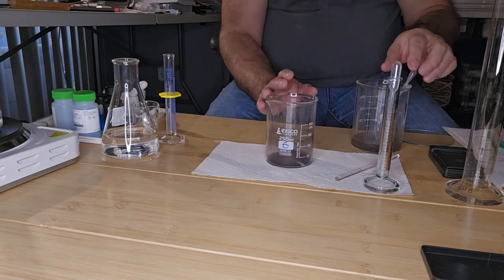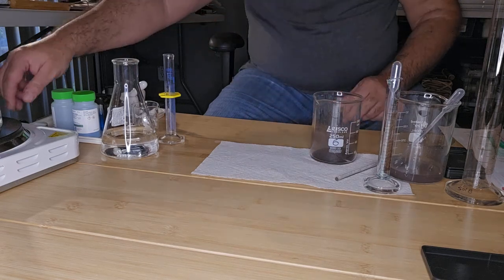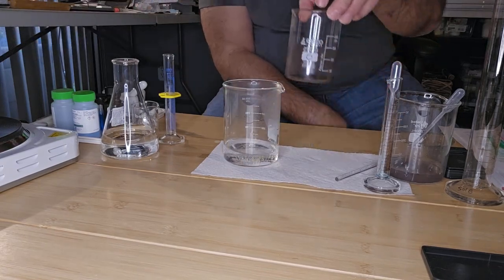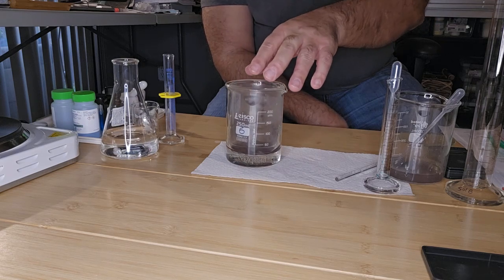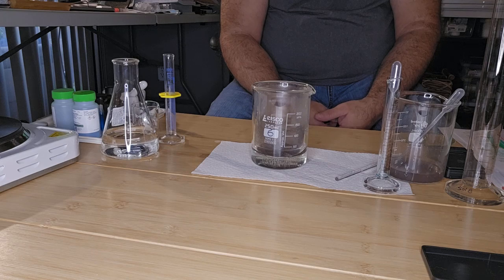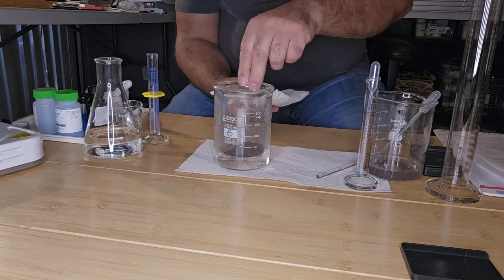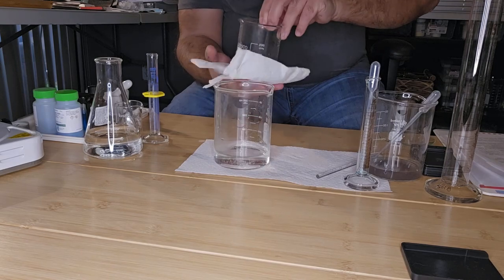Okay, so it's okay if you leave a little bit of acetone behind because we're now going to put it into the water bath to evaporate off. Okay, so I'm going to put this beaker into this water bath. And now I'm just going to leave that to evaporate out to dryness. So the acetone now has had plenty of time to evaporate off from the copper. So I'm just going to dry the beaker.